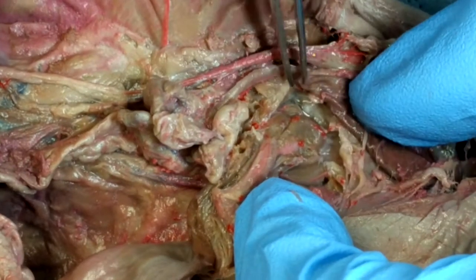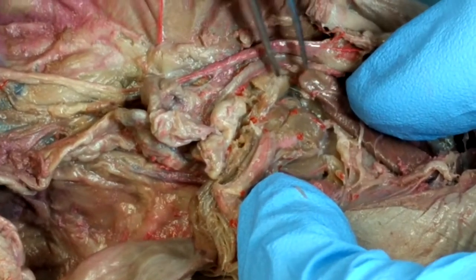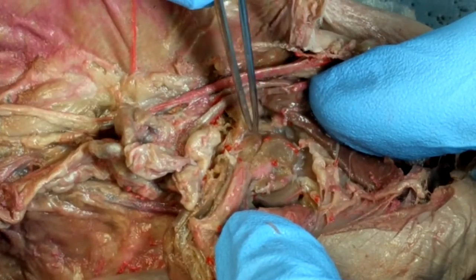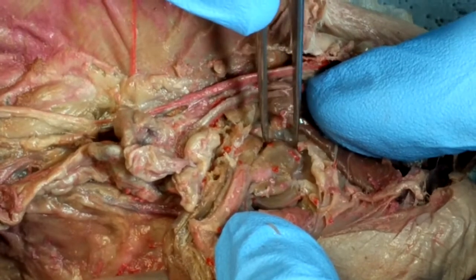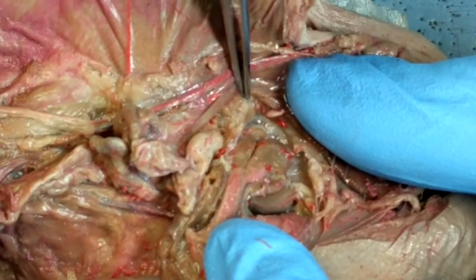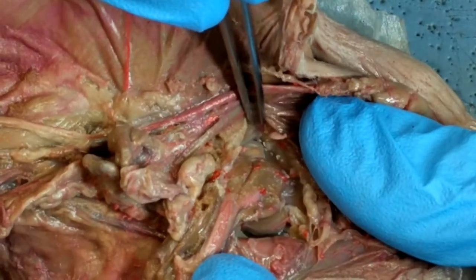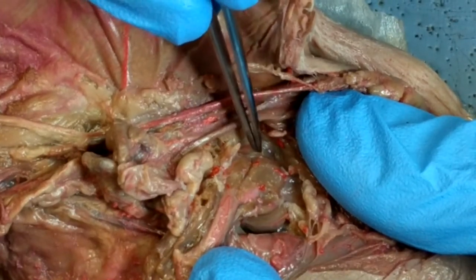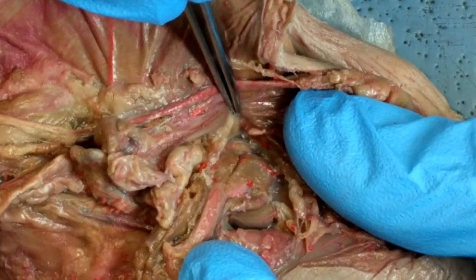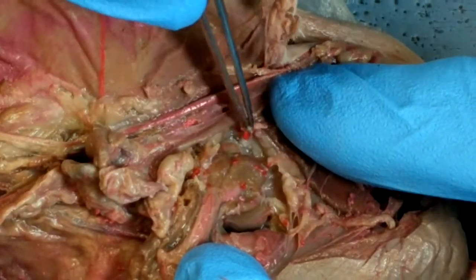There's a third structure — not a muscle but a gland — called the bulbourethral gland. It's located in between the ischiocavernosus and the bulb of the penis, but you have to push everything to the side and look back here — it's this little ball. This one is hard to find mainly because it usually doesn't preserve well and it also rips easily. If you don't know which one is the gland, you might accidentally pick it up.